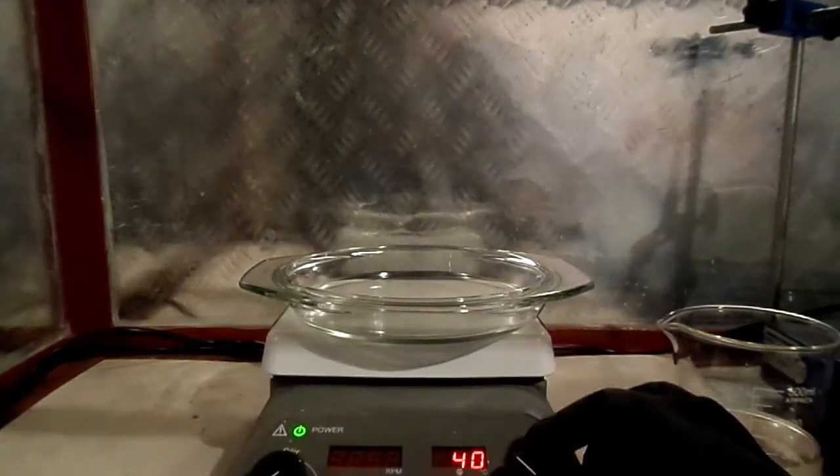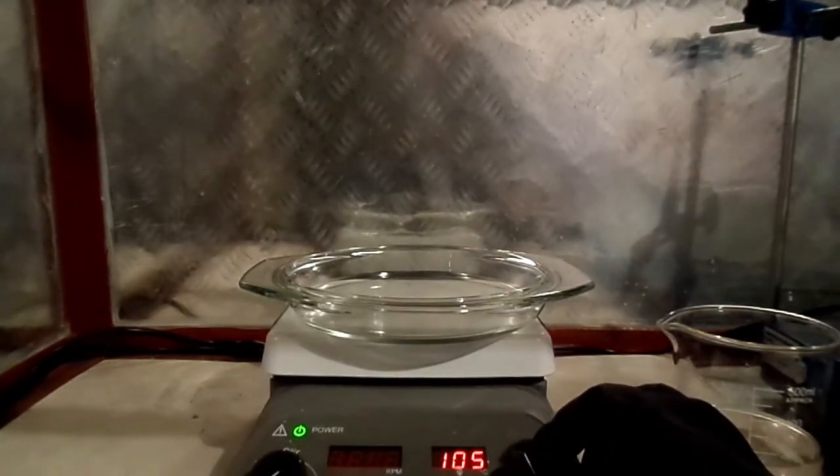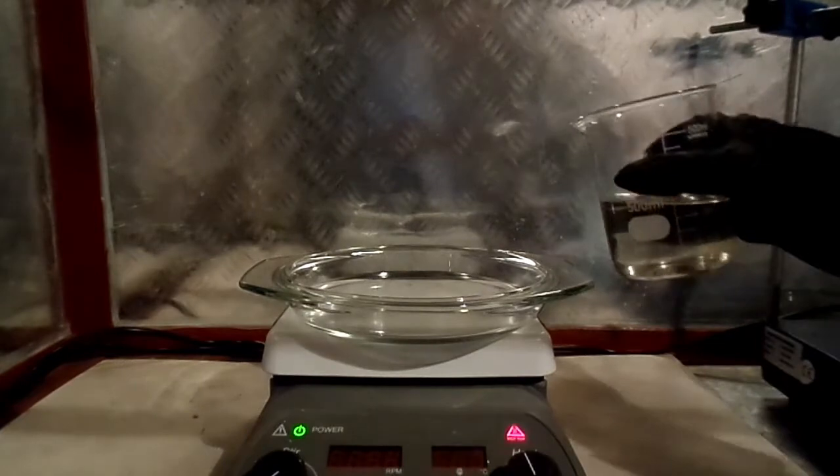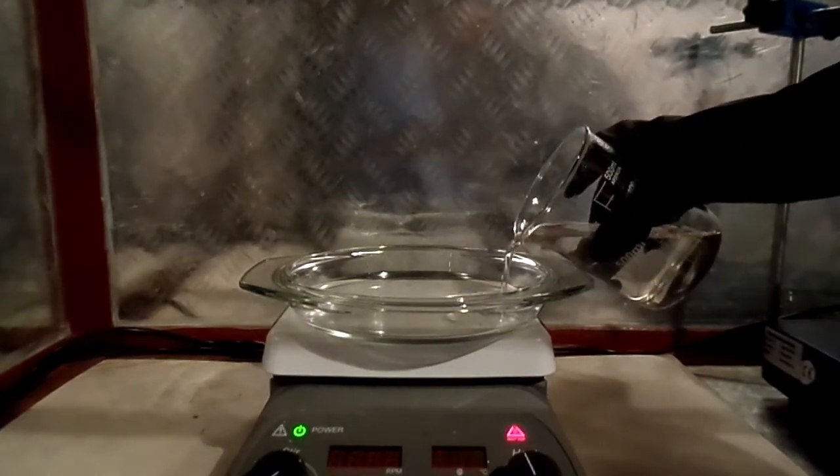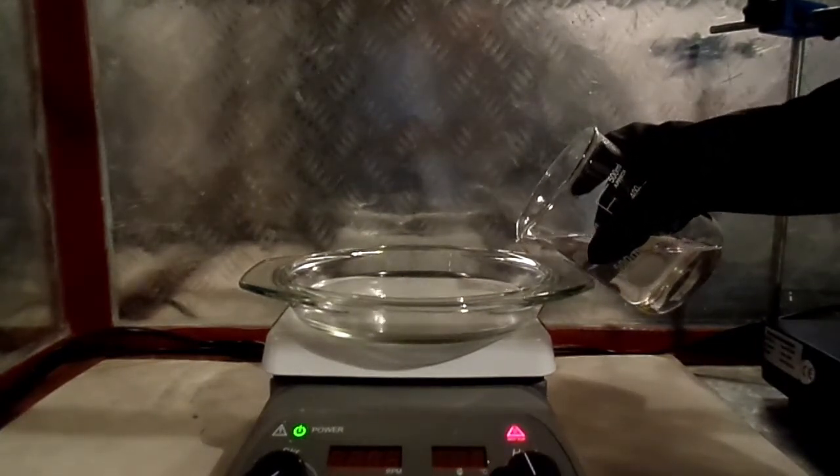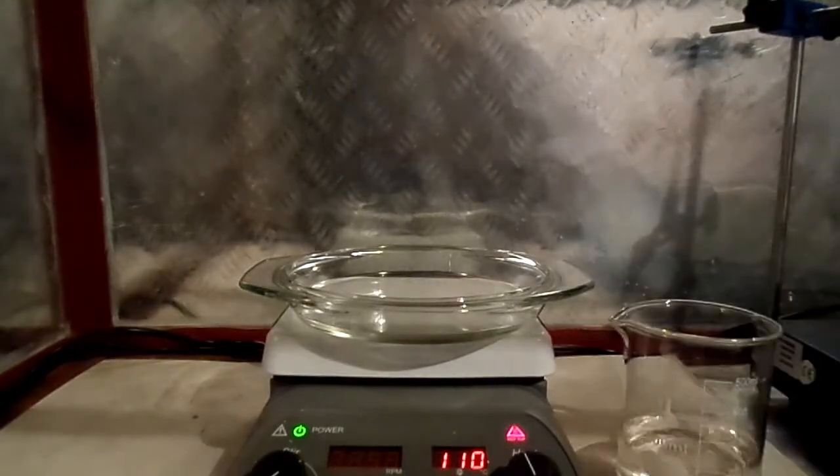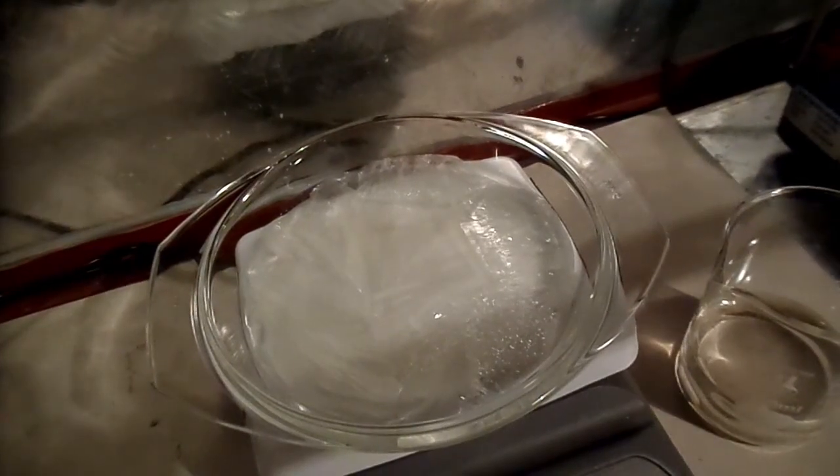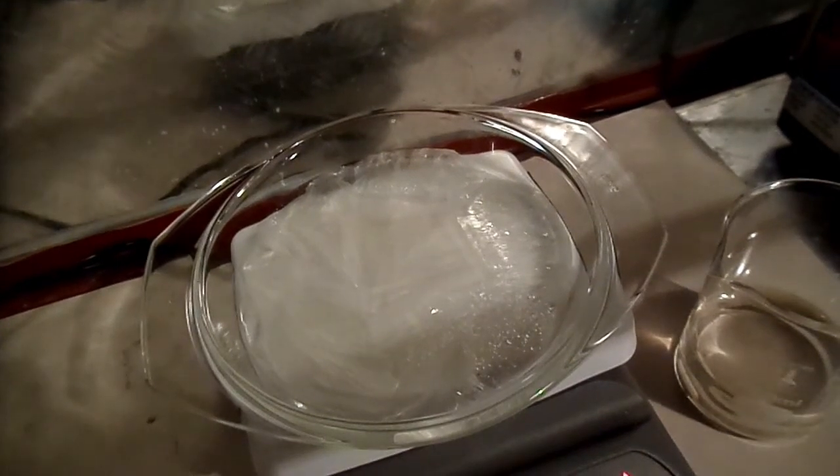Ammonium sulfamate is hygroscopic and will pull the water out of the air and hold onto it, which means we really need to crank up the heat in order to drive off all the water. The solution supersaturated and formed crystals immediately after I agitated the solution.